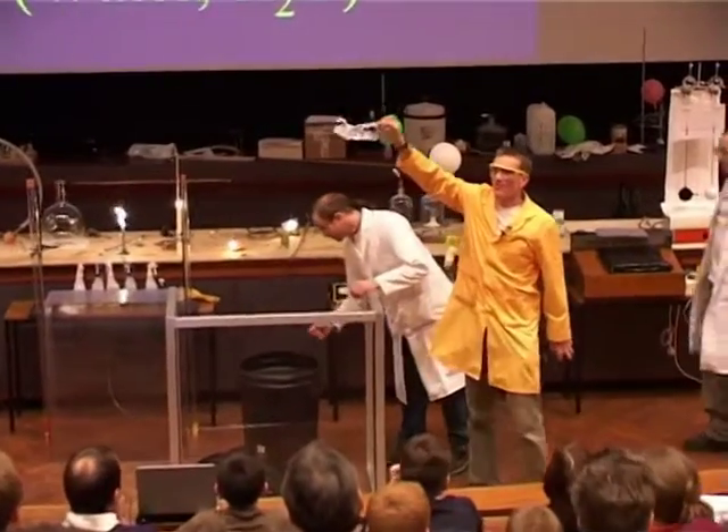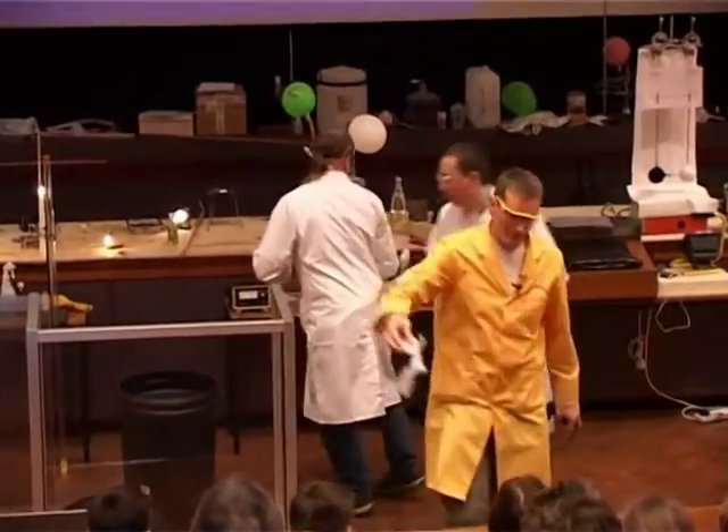And that's what's left of our bottle there. Perhaps you'd like to pass that round.